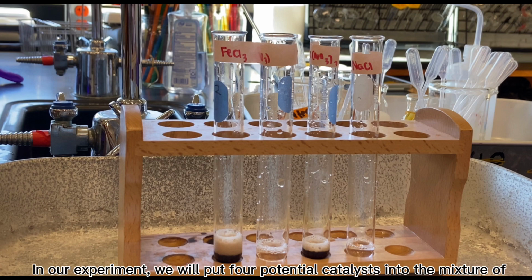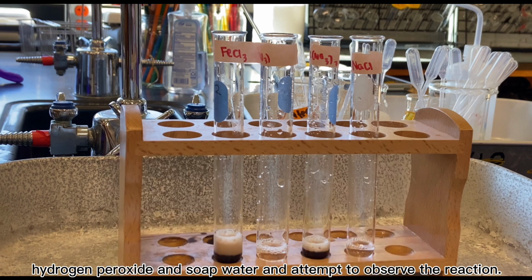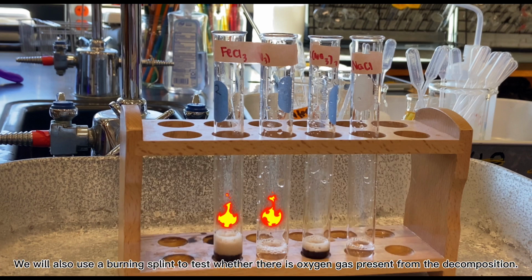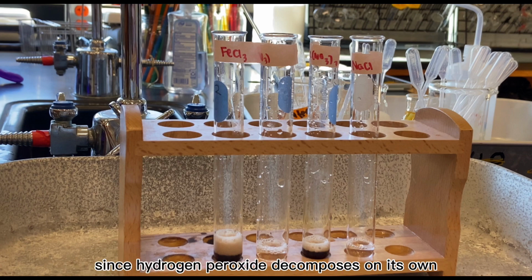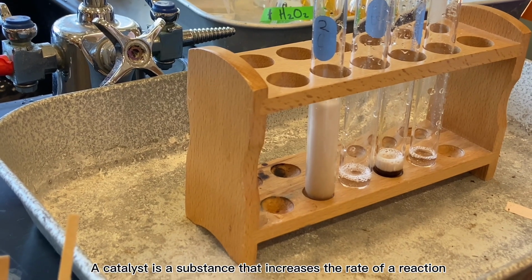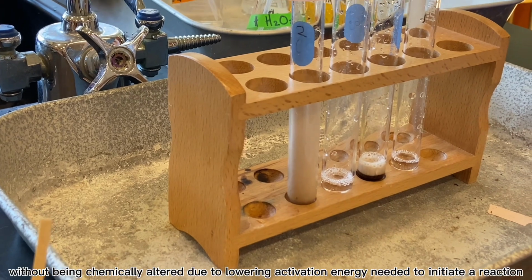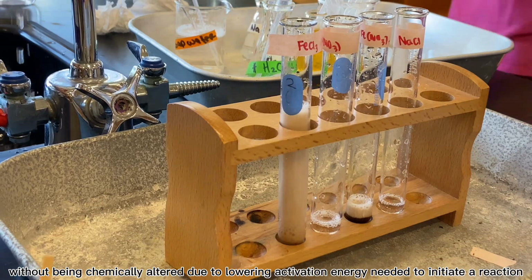In our experiment, we will put 4 potential catalysts into the mixture of hydrogen peroxide and soap water and attempt to observe the reaction. We will also use a burning splint to test whether there is oxygen gas present from the decomposition. The catalyst should decrease the activation energy of the reaction. Since hydrogen peroxide decomposes on its own, the catalyst should cause the reaction to happen more quickly and be more pronounced. A catalyst is a substance that increases the rate of reaction without being chemically altered, due to lowering the activation energy needed to initiate a reaction.